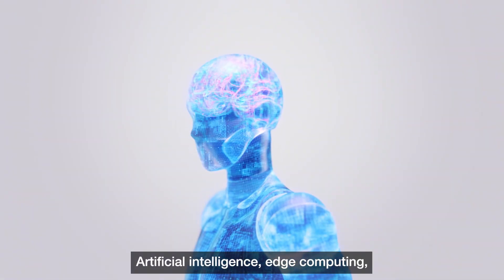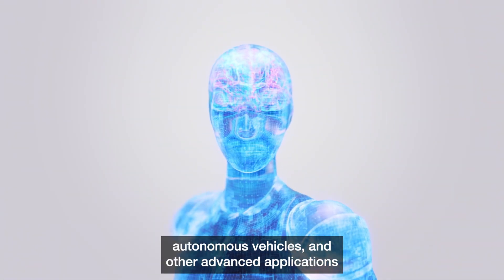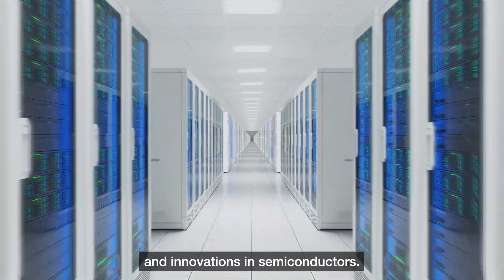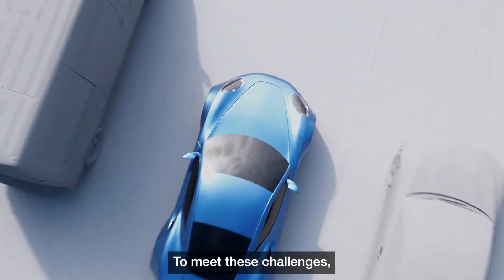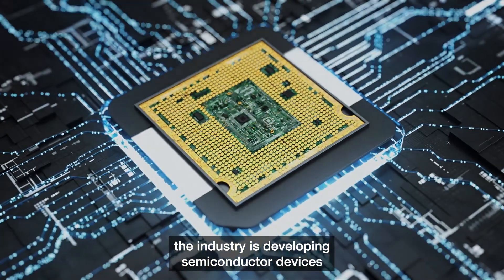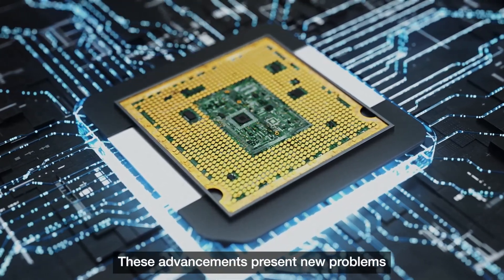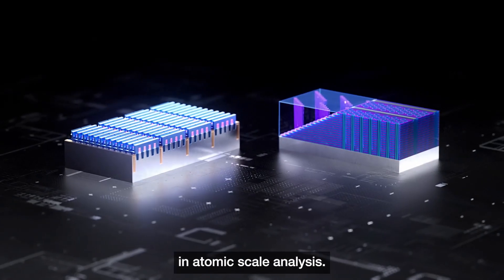Artificial intelligence, edge computing, autonomous vehicles, and other advanced applications are driving unprecedented investments and innovations in semiconductors. To meet these challenges, the industry is developing semiconductor devices that provide greater performance, capacity, and power efficiency. These advancements present new problems in atomic scale analysis.